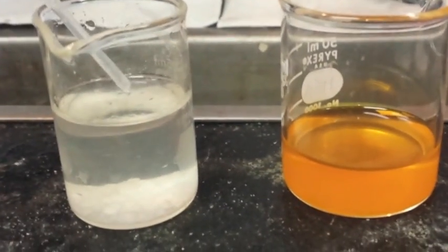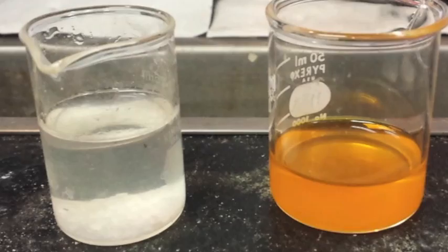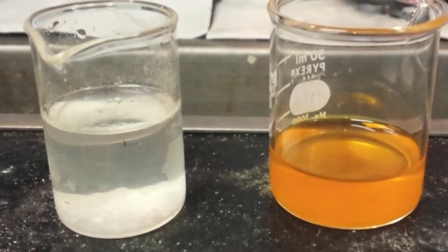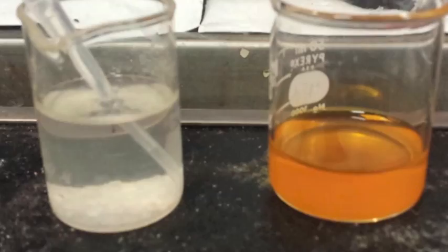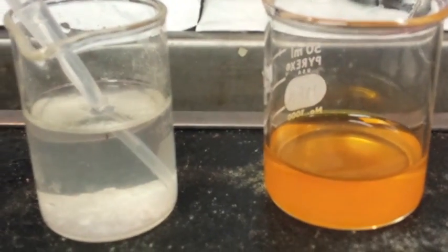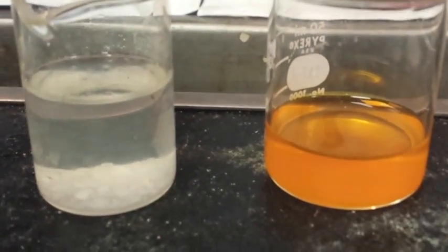And the reason is, this is an exothermic reaction. It will produce heat and it produces toxic fumes. So please do this under a fume hood. And it also produces hydrochloric acid as a byproduct.